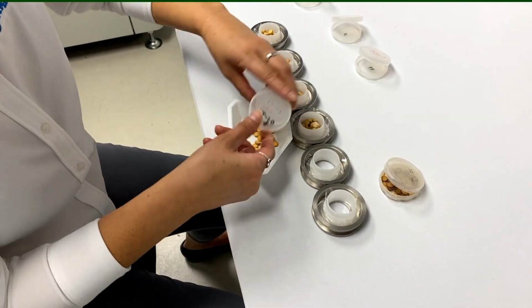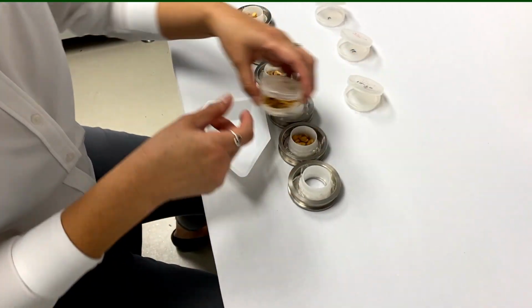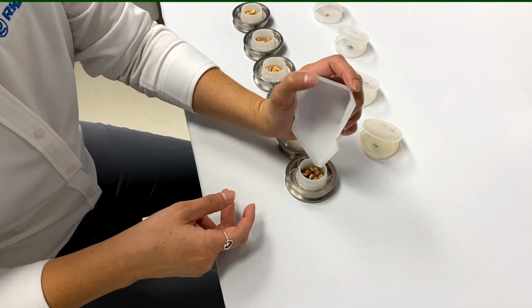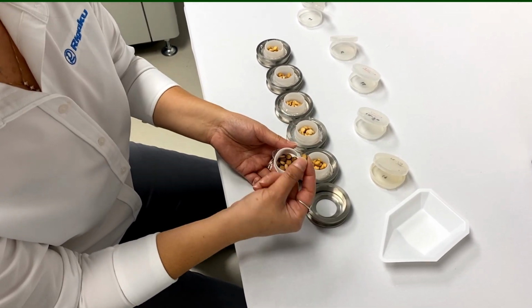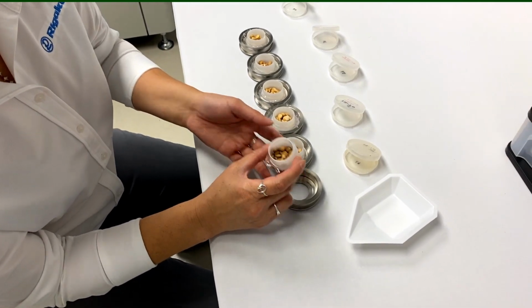So right now what we're going to do, of course, is put these on. We're going to make the calibration curve that's going to be saved on the system for years. And actually, this is about a 4-year-old method, Thanh? Yes. And so it's still actually, we can analyze these same samples and get the same results. You've noticed they've charred a little bit because we've analyzed them multiple times and they're still good to go.